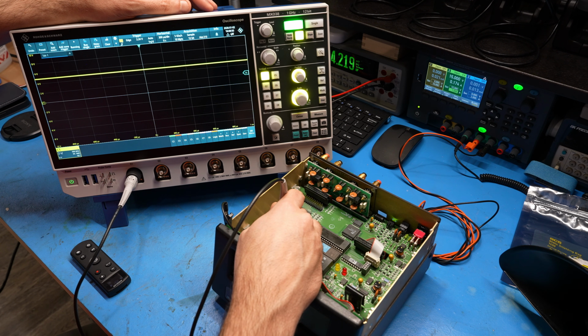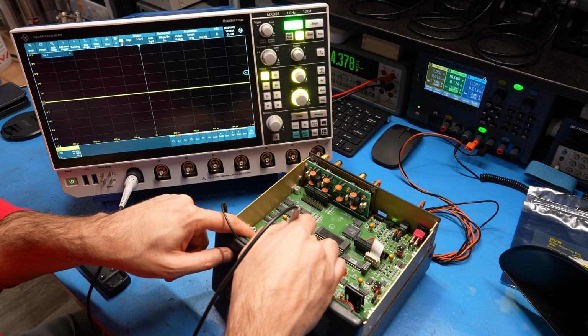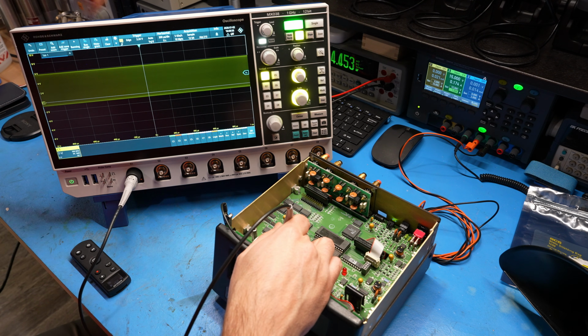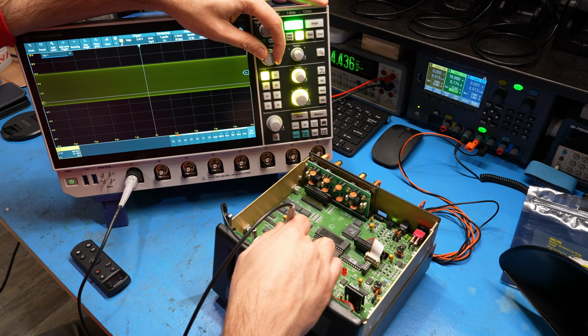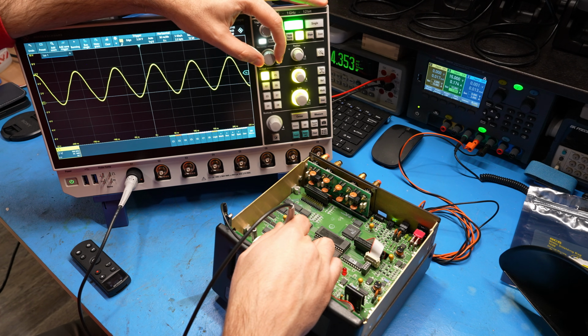There it is, 5 volts. That's to be expected, directly connected to the DC-DC converter. Let's see, do we have any clock activity? And yep, we definitely have our clock, which is nice. There you go, zoom in a little bit more. There it is. Yep, it is definitely present, so that's not an issue.